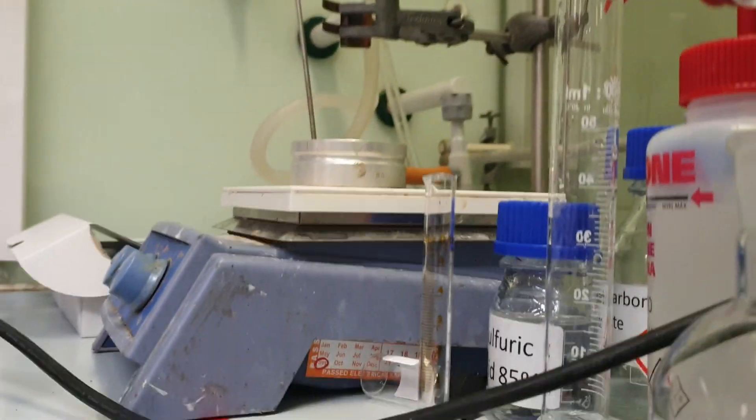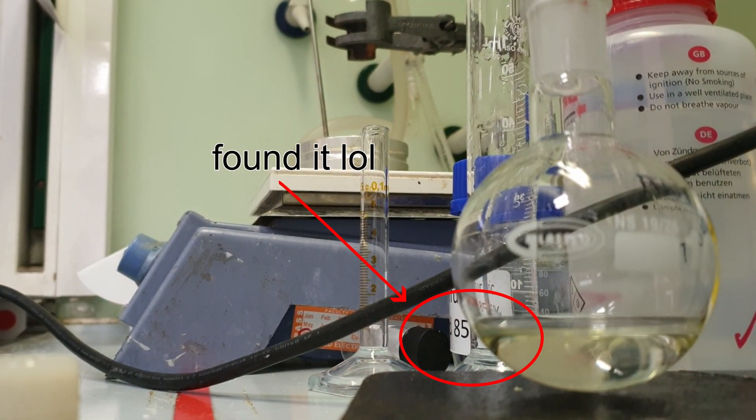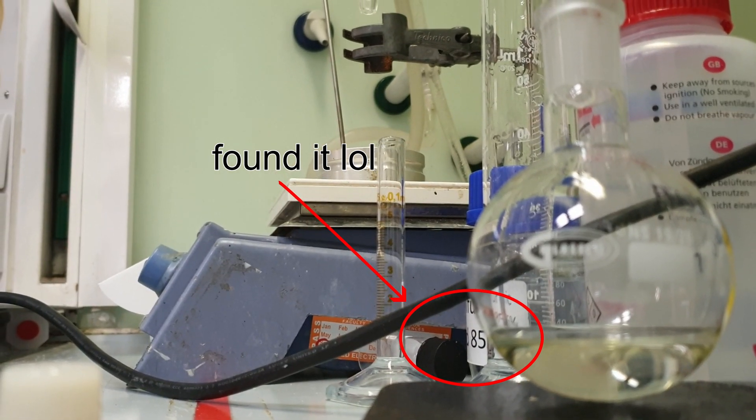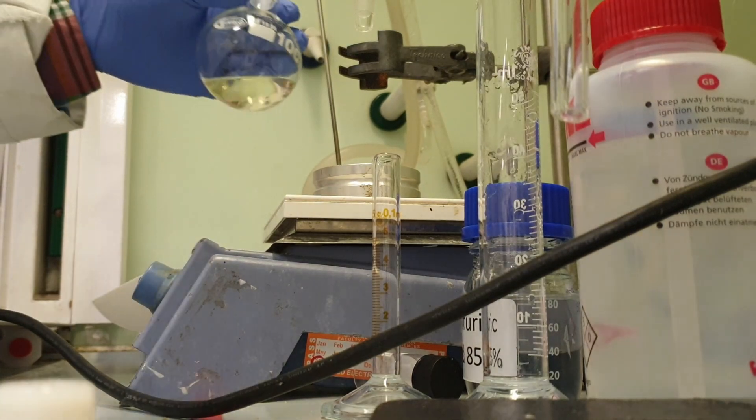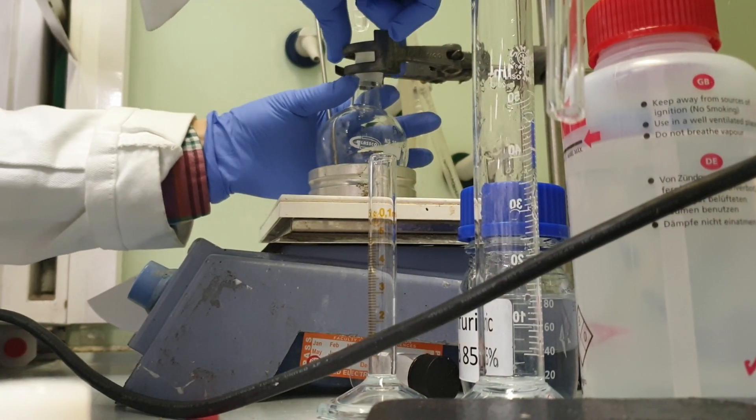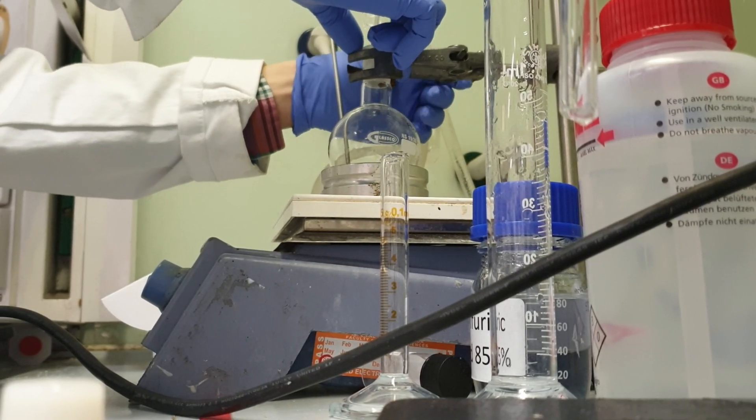I can't remember the exact concentration, maybe I'll go give it a check. It's 85% sulfuric acid and hexene. I did not see what was gonna go wrong here, but we're about to find out.